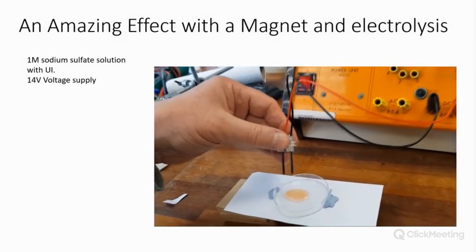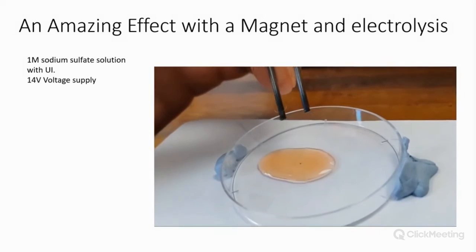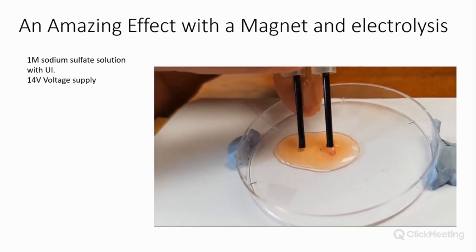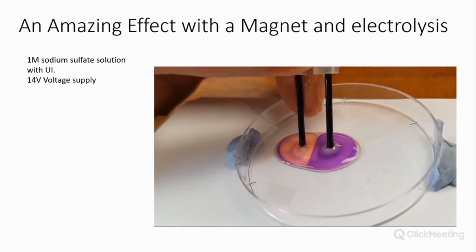And of course, being a physicist, he likes to go the whole hog and put 14 volts DC through it. I didn't want to do that, but he said, "Oh, come on, let's do it." So, are you ready? Well, what do you think is going to happen? Well, let's see. And the colors of the indicators revolve.